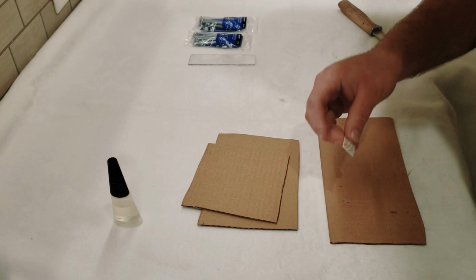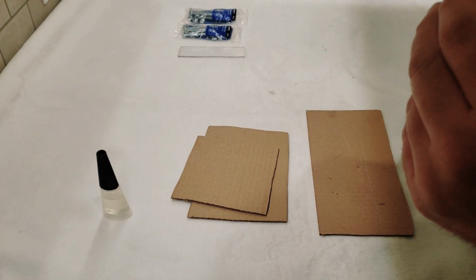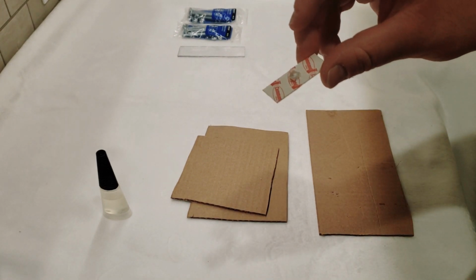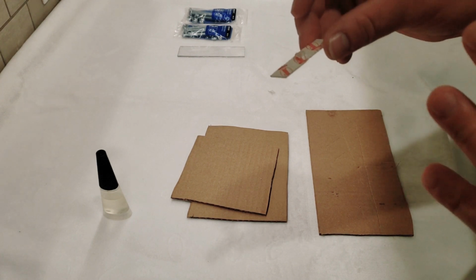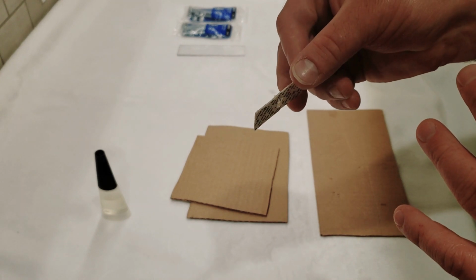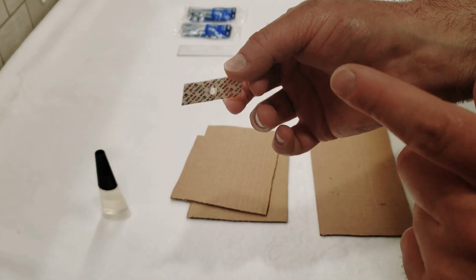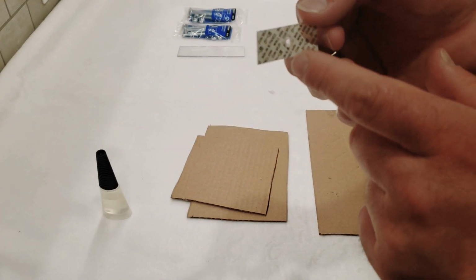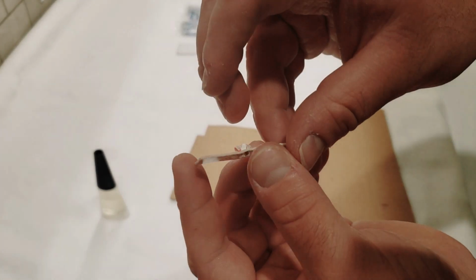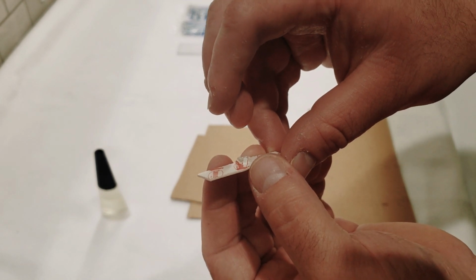All right, so that took about 10 minutes longer than I wanted. But what I did was I went and switched out the tape around the lens for a stickier tape, so it held the lenses in place better. And then I switched out that thick foam pad for this thinner one and kind of just cut an X where I wanted it to go and pushed the lens through, pulled back the paper and pushed the lens through. So now it's got a few little tabs around it that are kind of sticky, holding it in place.